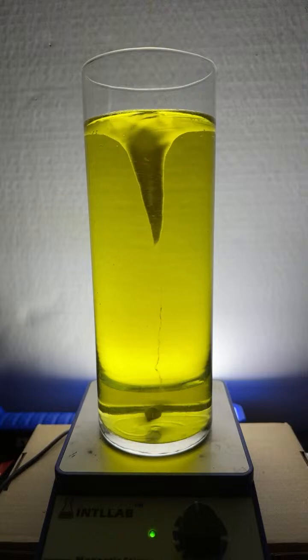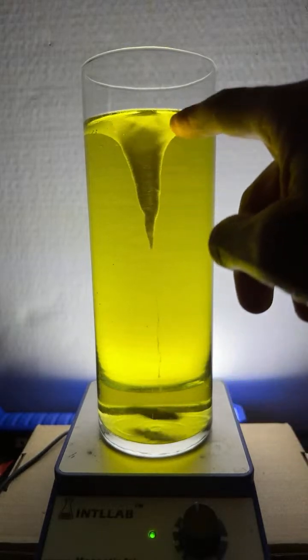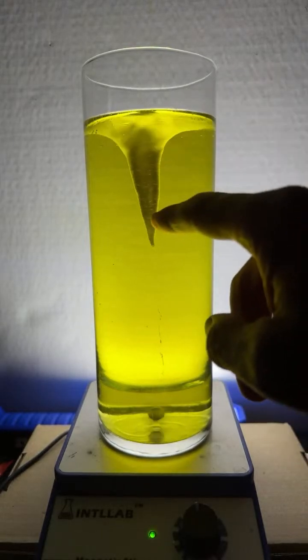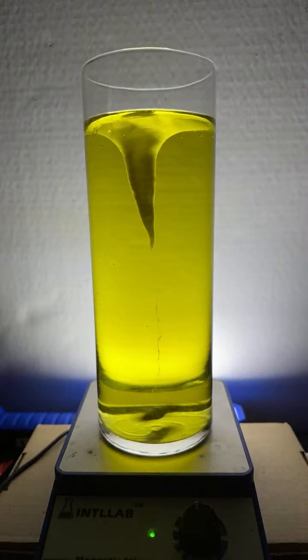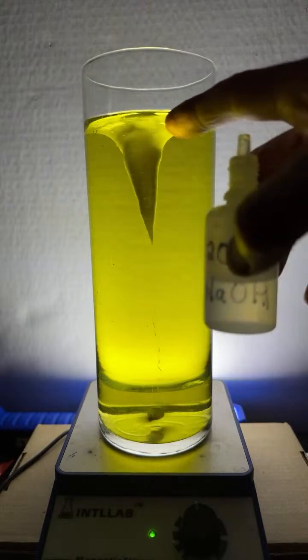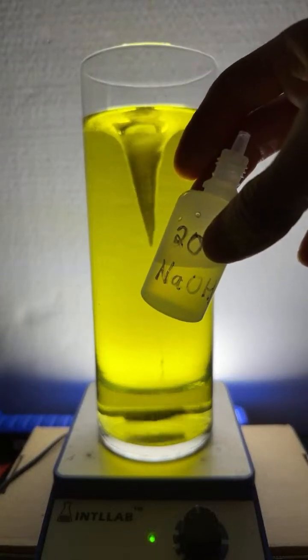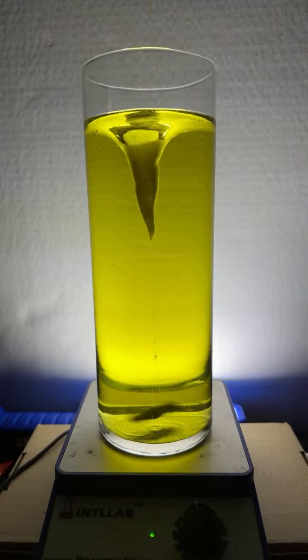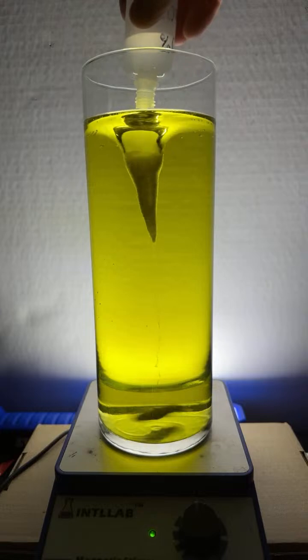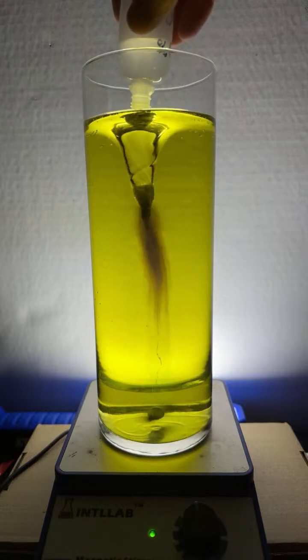I don't know, Torvis. All right, you see how all those bubbles ended up in the funnel? So that's a bunch of carbon dioxide. And now what I'm going to do is, so to speak, scrub submarines, Douglas, great point. I'm going to scrub the carbon dioxide bubbles out of the funnel with sodium hydroxide. Sodium hydroxide reacts with carbon dioxide gas, and it forms a salt that'll dissolve in the surrounding water. So here we go. Check it out. I'm going to add the sodium hydroxide and just watch what happens to all those bubbles.